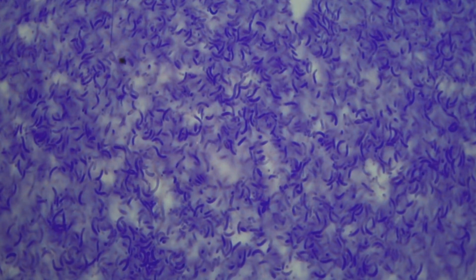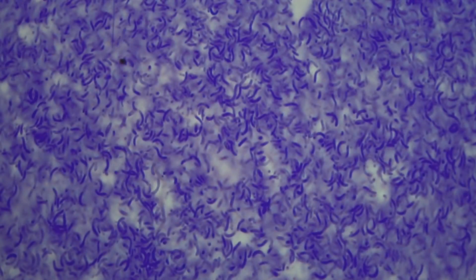I simply slid the old slide out. I have oil droplets already on the other slide, and I moved that in. Now what I need to do is tweak the fine focus knob and look at what we have. And we have some movement there, and you say, oh wait, I thought she said she killed those cells when she heat fixed them. In fact, I did, but what you are seeing is the Brownian motion because there's still a little water left on the slide, and that water mixing with the oil is giving us the sensation of motility.